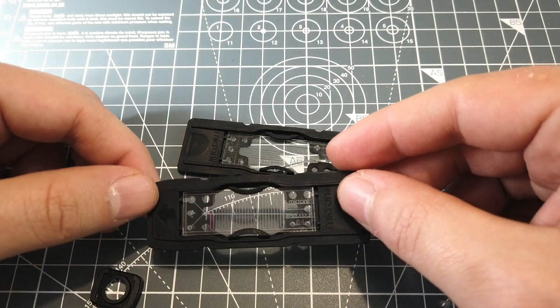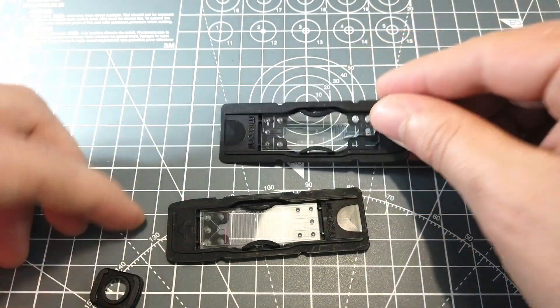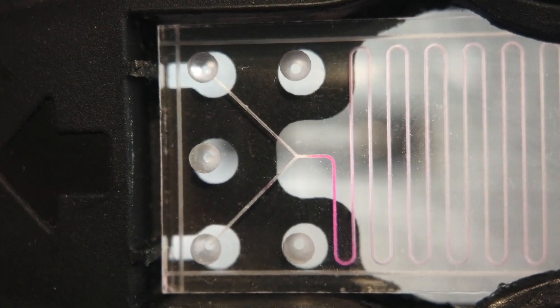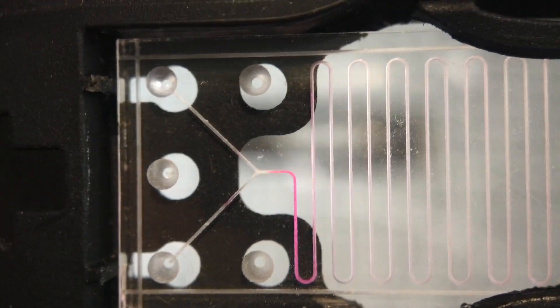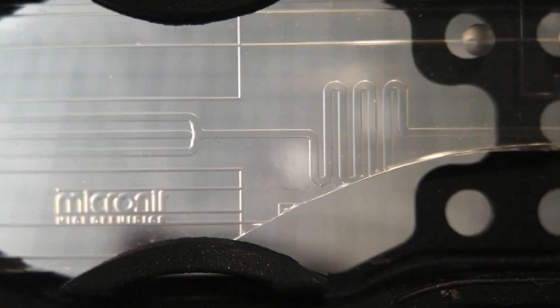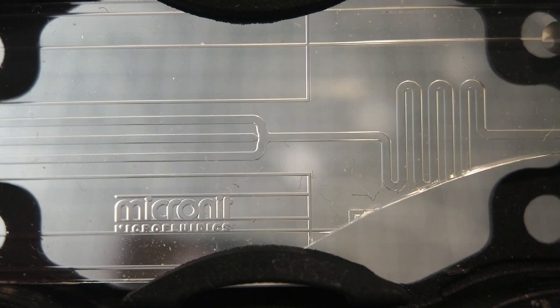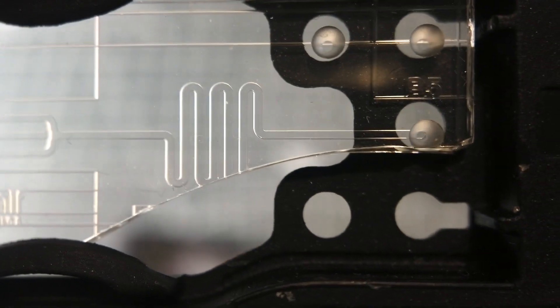As you can see here, those are the glass microfluidics — you can still barely see them. This one is obviously the broken one. Now you can definitely see them. So this one was the Y-channel: two different inlets, then you have a long reaction section, and then one outlet. This is how it looks. And this was a droplet generator — you can see the internal part. This one is for making small droplets.